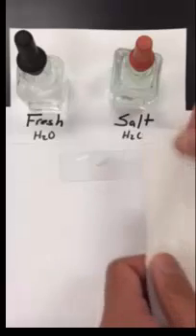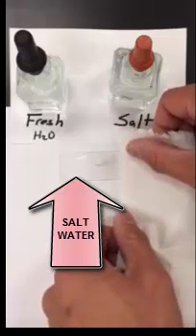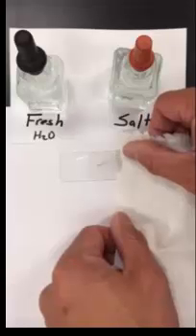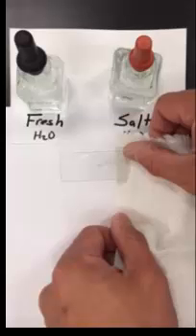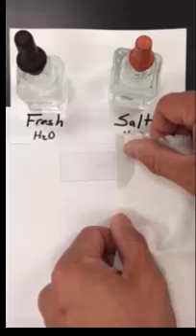Once we do that you're going to take your paper towel and you're just gently going to place the edge of the paper towel along the opposite edge not where you put the salt water but along the opposite edge and then just slide it so it touches the cover slip and you can see the water get pulled across. This is going to pull the salt water across the cover slip and then submerge your onion cells in salt solution for viewing for osmosis.